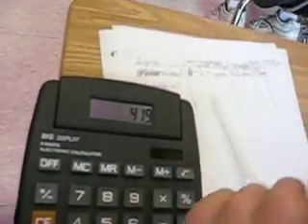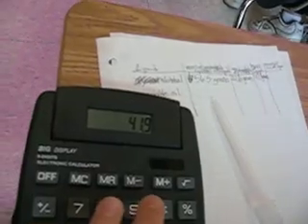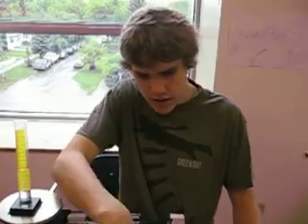So we got to find out how much it is for one milliliter of liquid. We divide it by 50, and that equals 0.8 — or we'll round it up. So that's how much one milliliter of this liquid is. Then you finish up the rest of your chart with vegetable oil and water. I don't want to bore you, so that's all I'm showing you — just the alcohol.